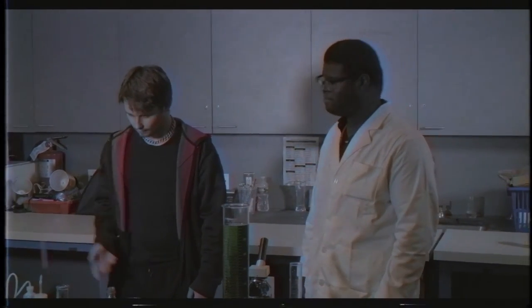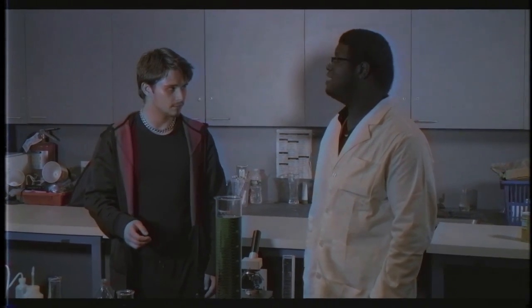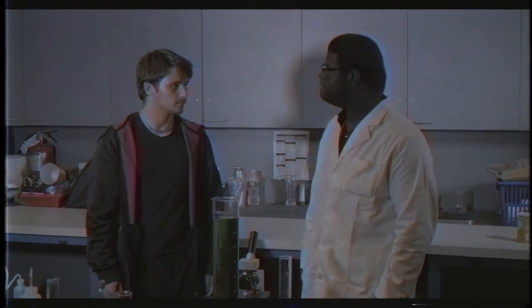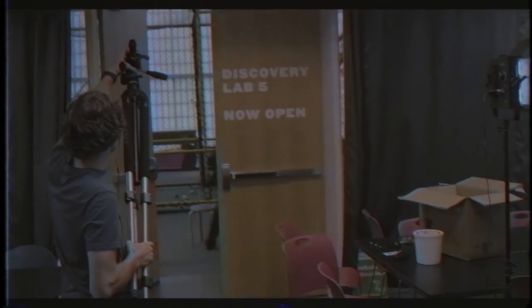Why aren't you wearing proper clothes? We're getting started with the poison ivy shower, right? Wait, what? You don't ever pay attention to me. Poison ivy? I thought this was grass. Rule number three, please remember to wear the proper safety equipment in the lab room, or else.